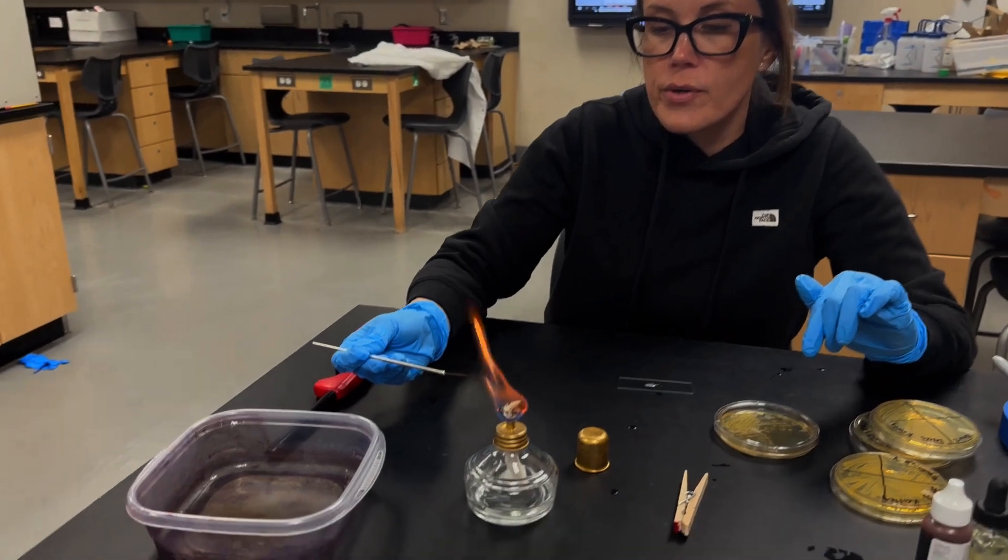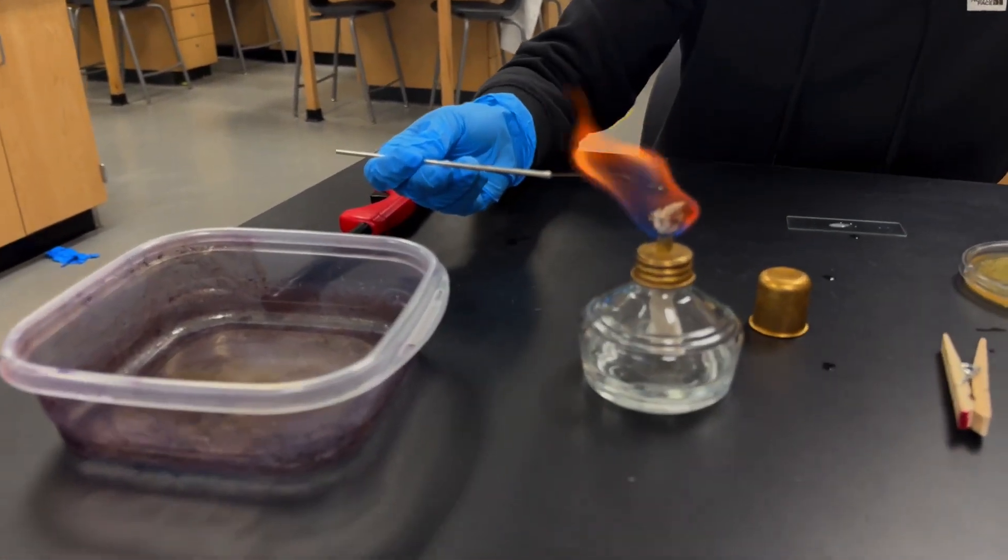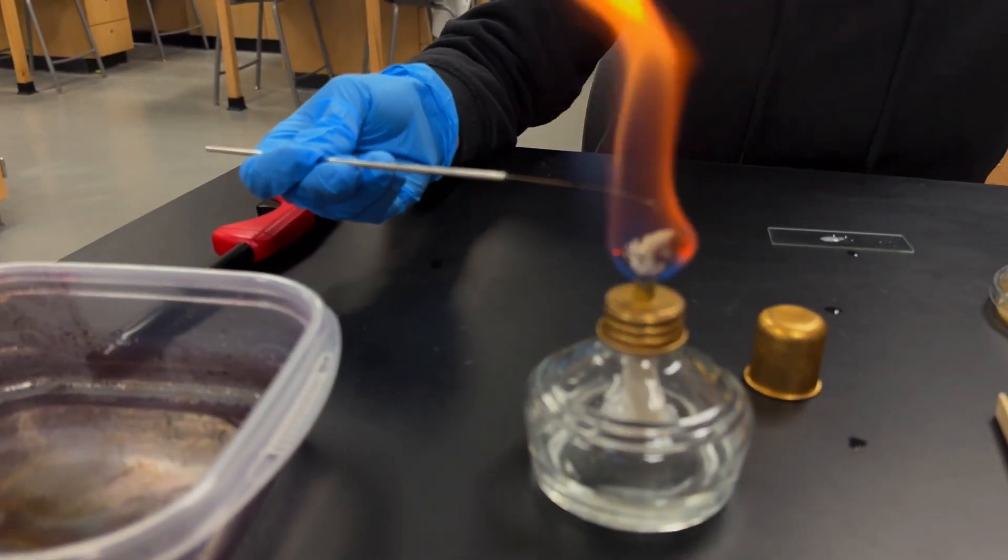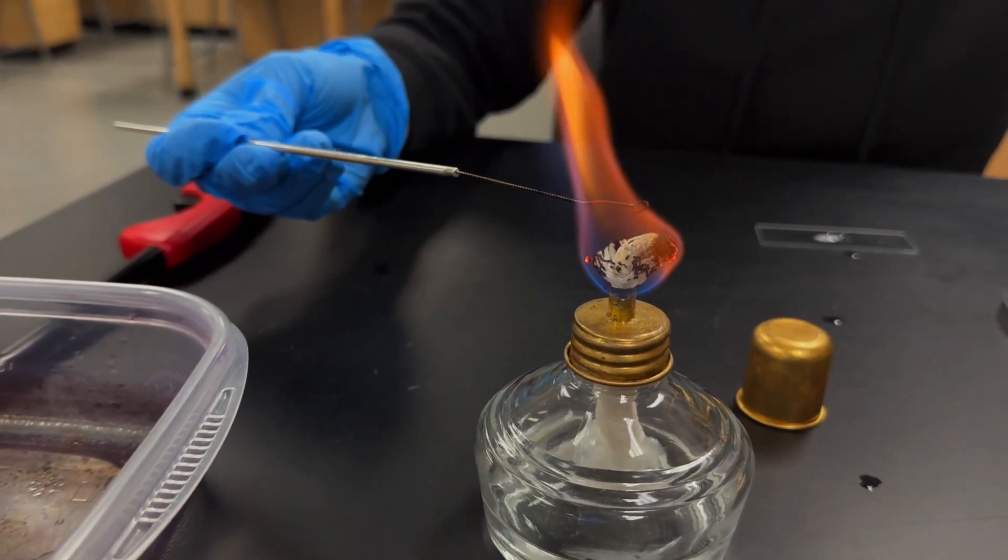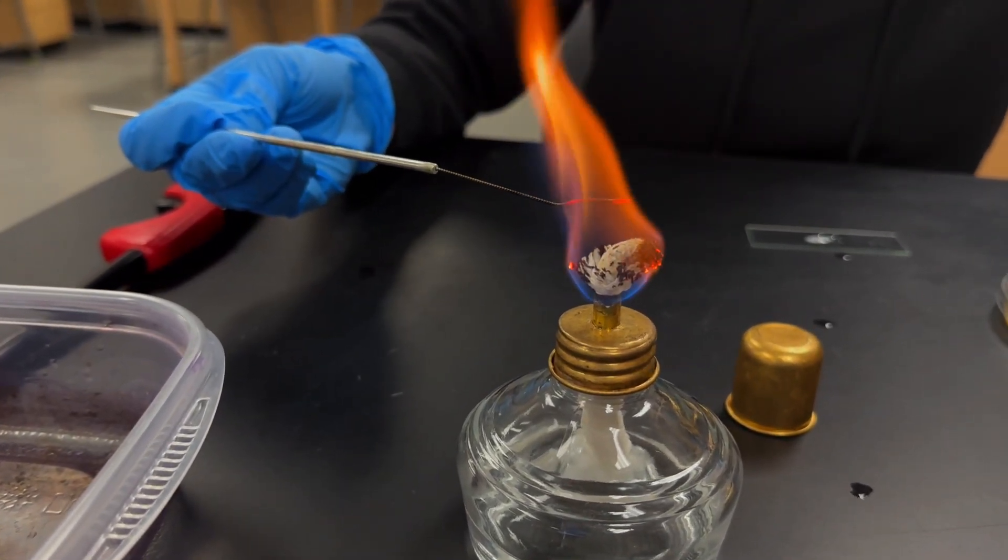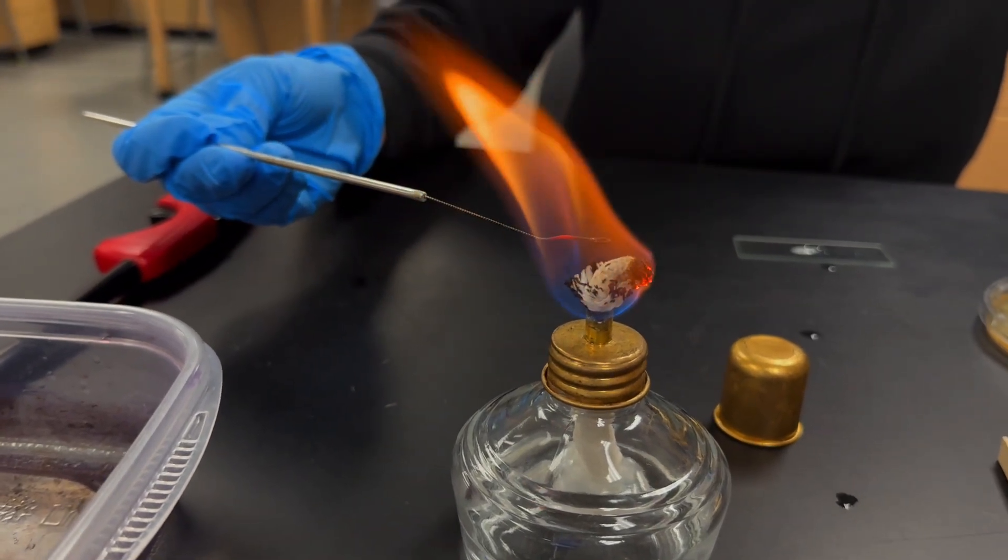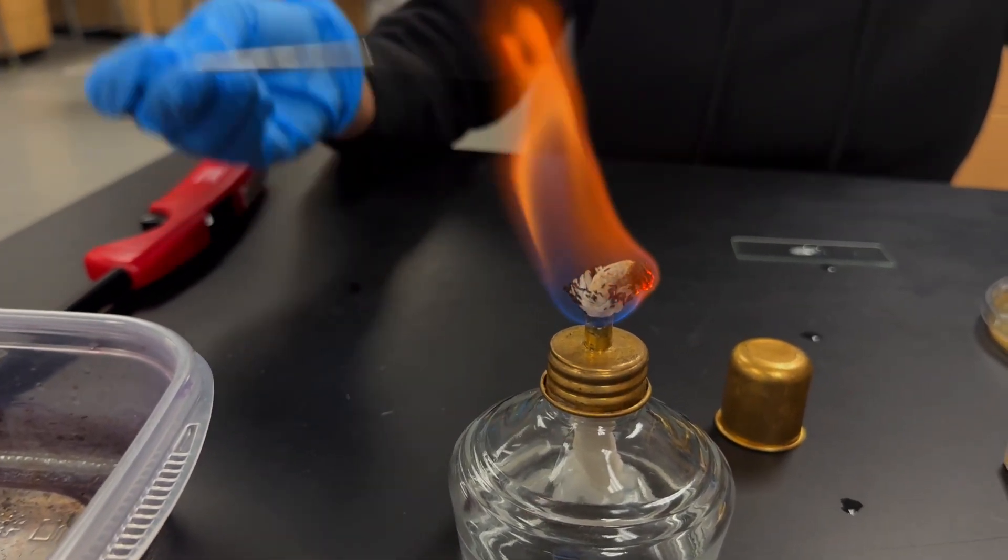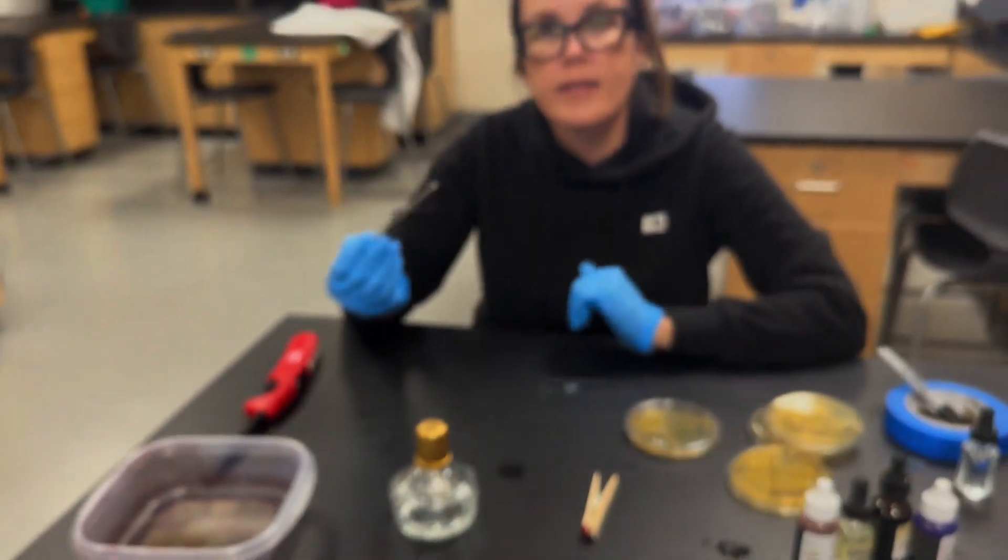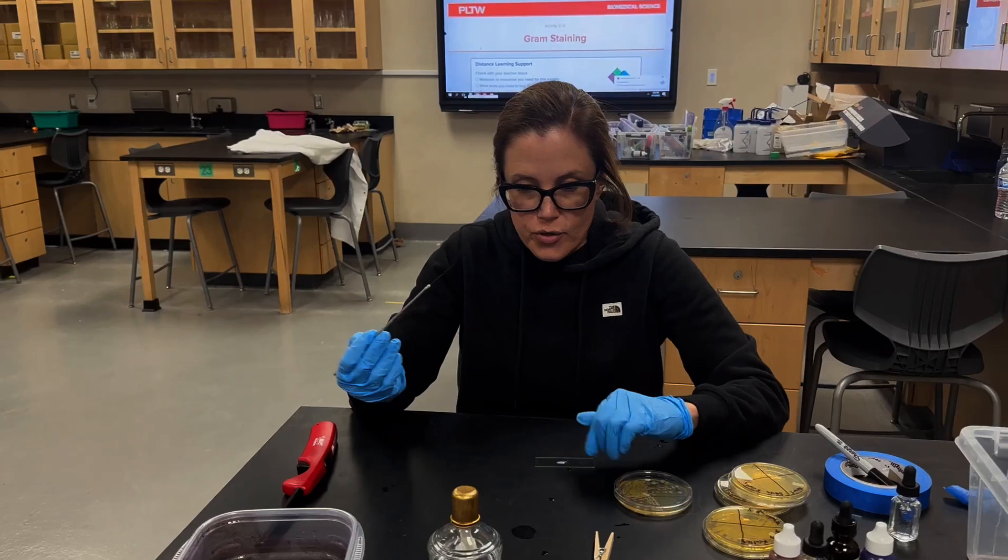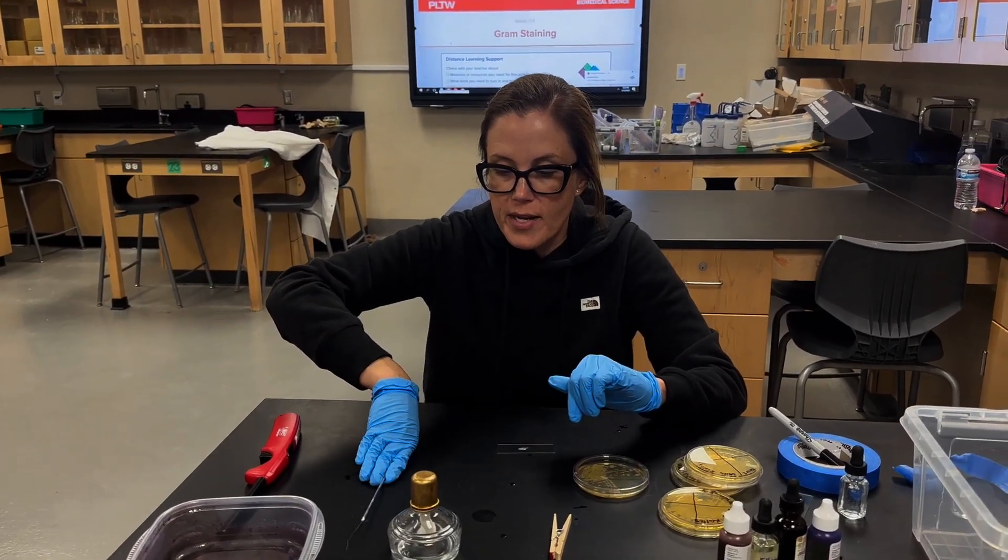You're going to sterilize your loop. And now we will extinguish the flame and let our slide dry and wait for the next step.